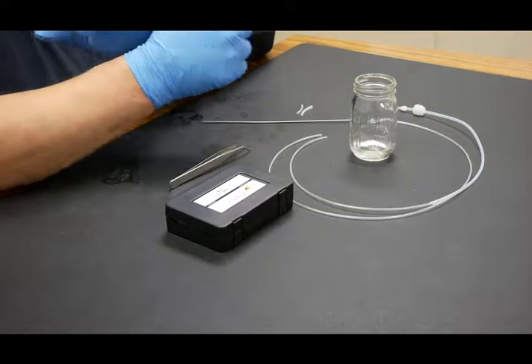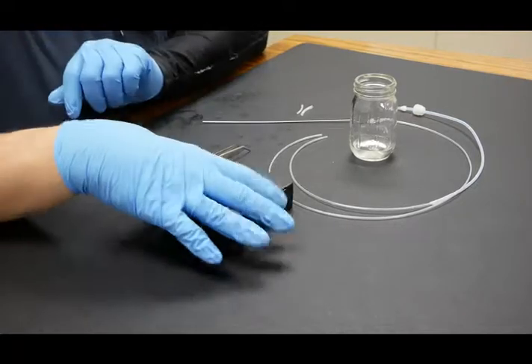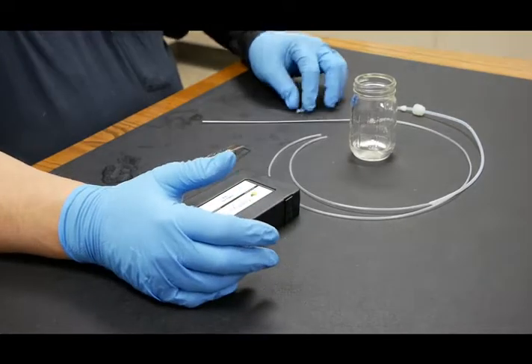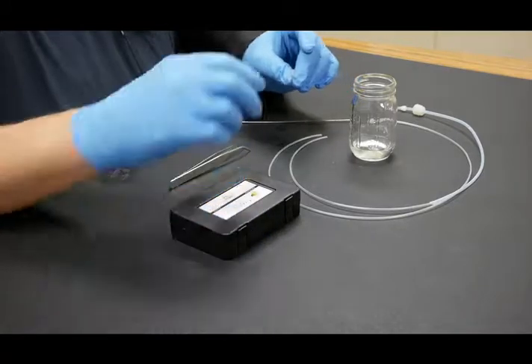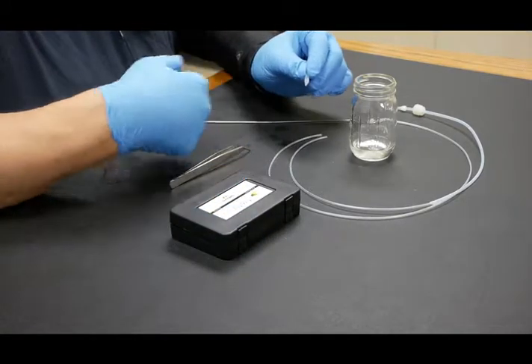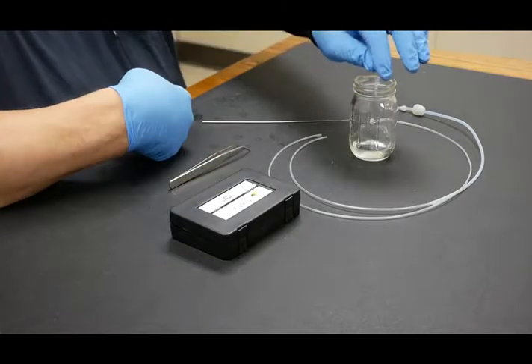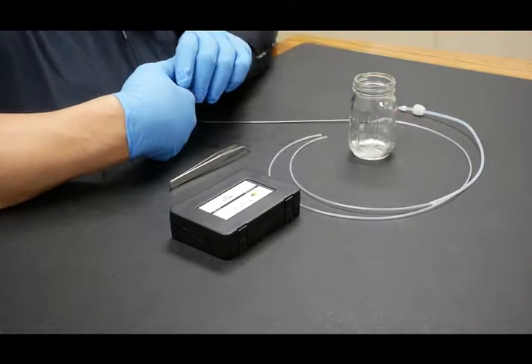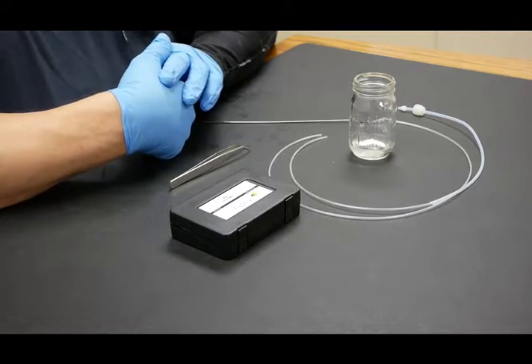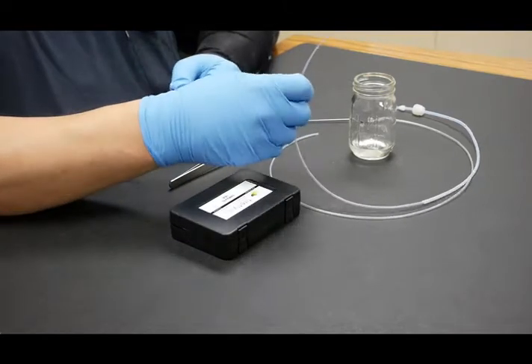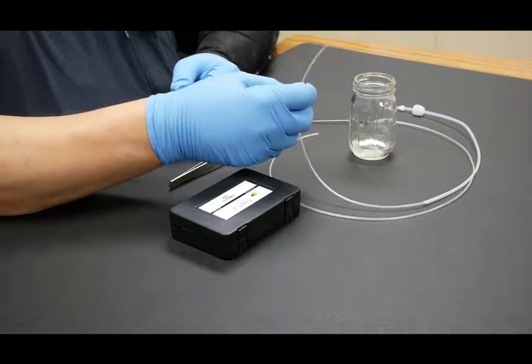You will need gloves, a flow cell, and some AU0013 silastic tubing cut somewhere between three-quarters of an inch and an inch and a half long, which you will soak in a small container of chloroform for at least five minutes so that it can expand. You will need probe tubing, AU0011.